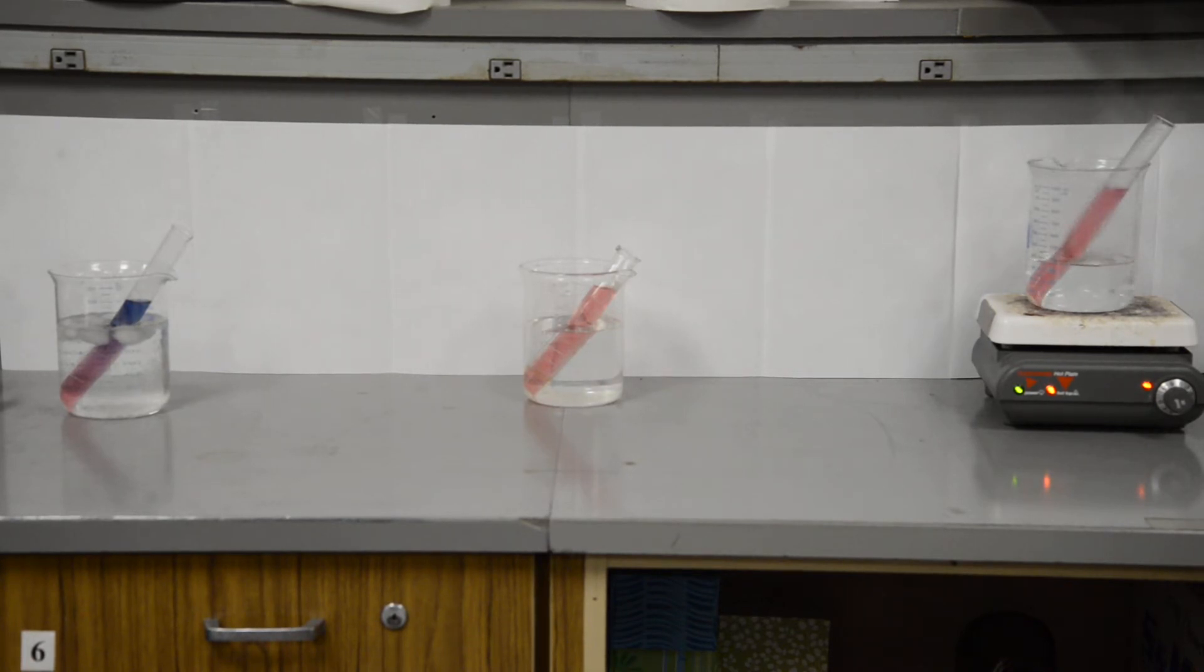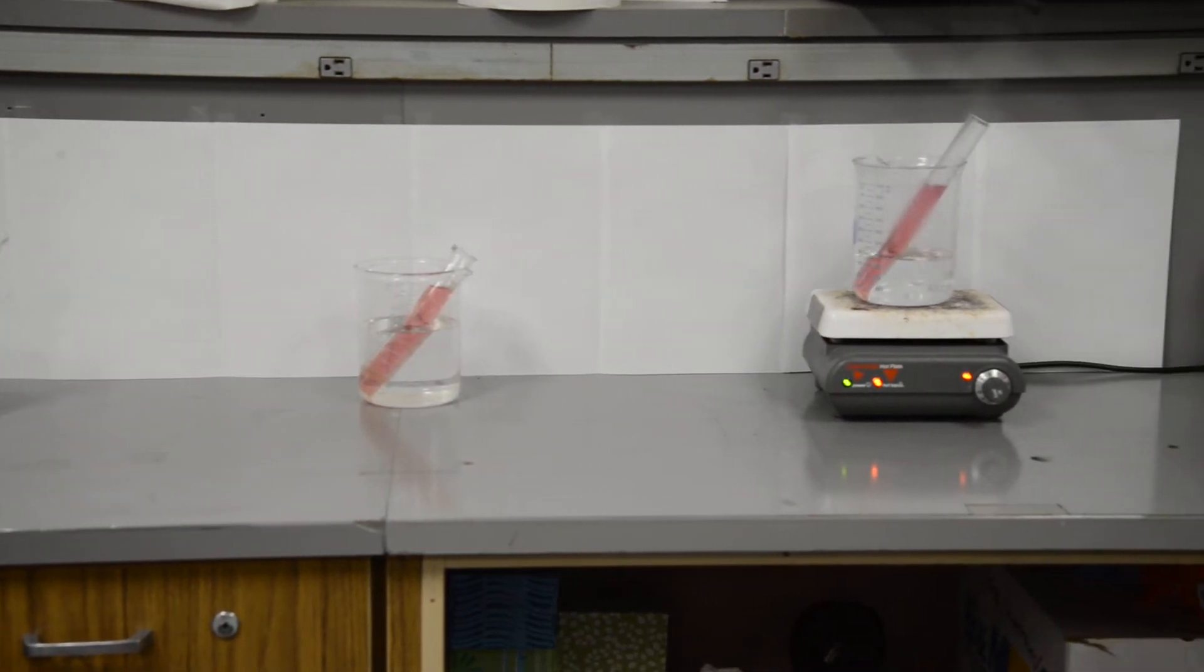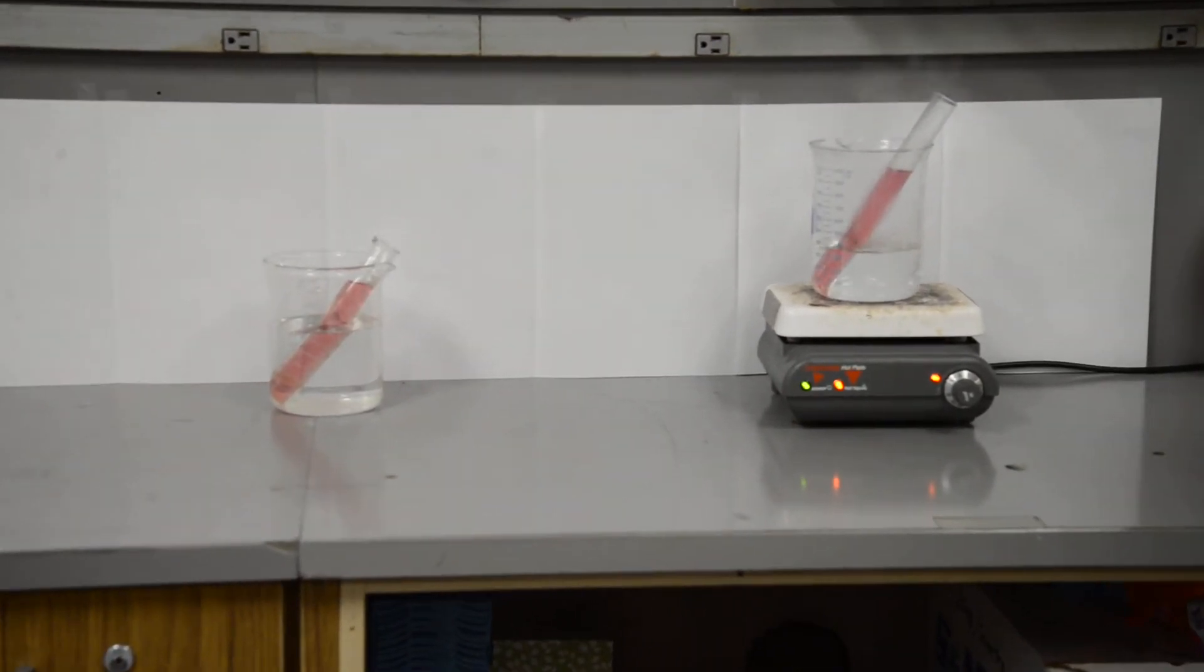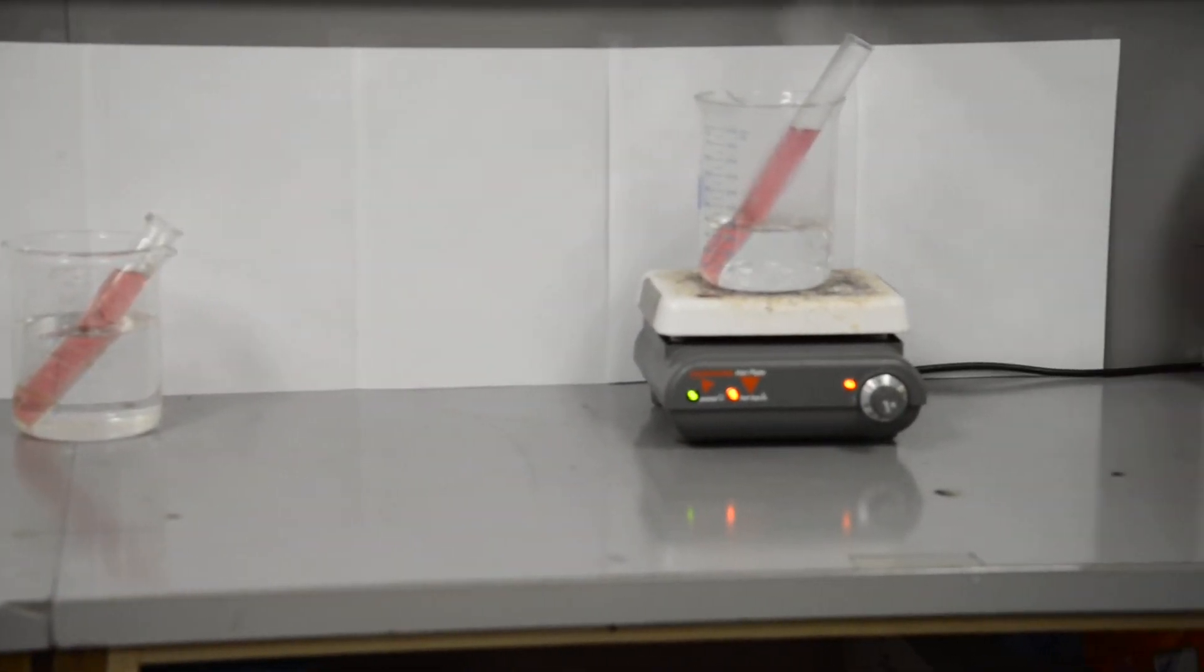Now if we look over in the hot water bath, you can already see that there is a color change. It's starting to turn slightly blue.